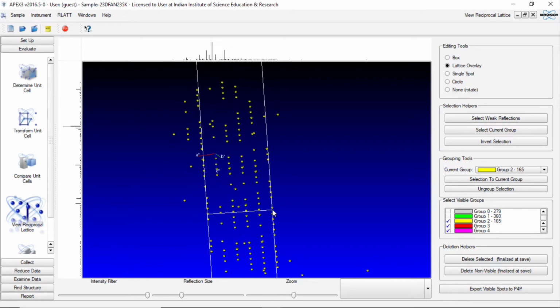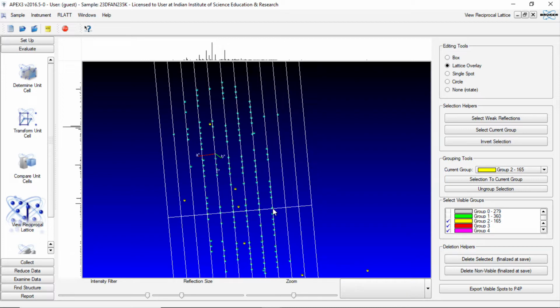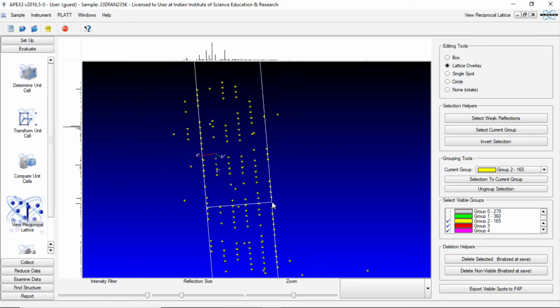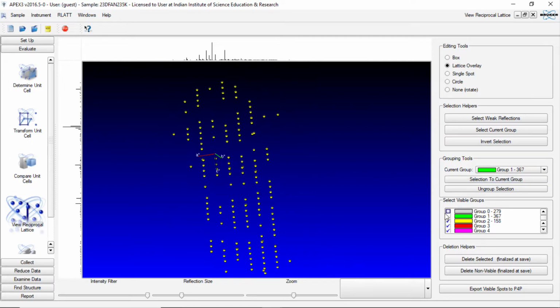So again, to reduce the number of parts, we should press minus, take the two ends and then press plus till it matches the lines. Then you go page up and include the reflections on either side and do an invert selection. And sorry, I made a mistake. Invert selection, and then I should have clicked different. So we do it again. Page up. Invert selection. Make it green and throw away those reflections in green.